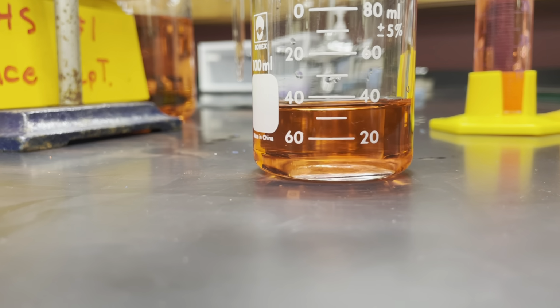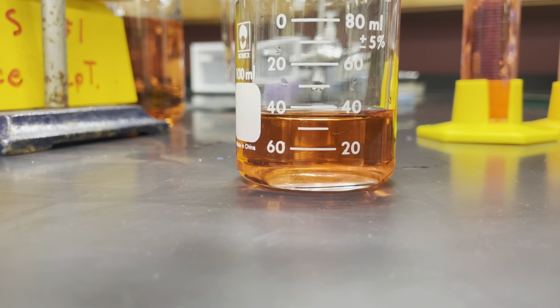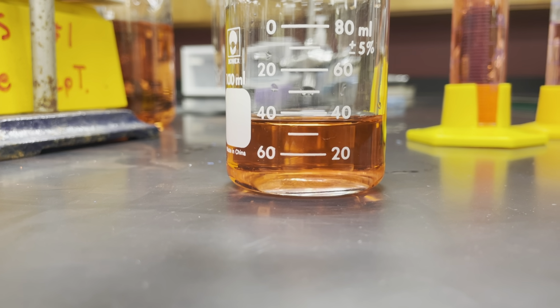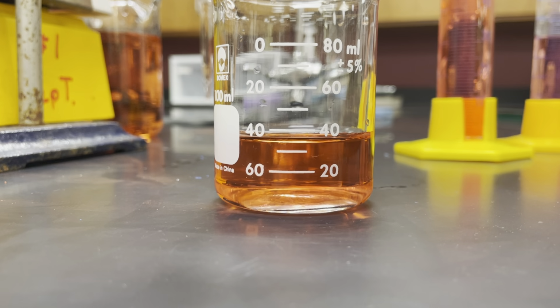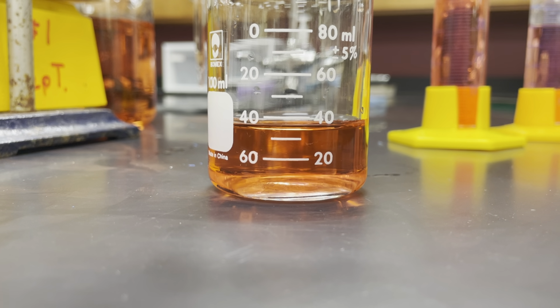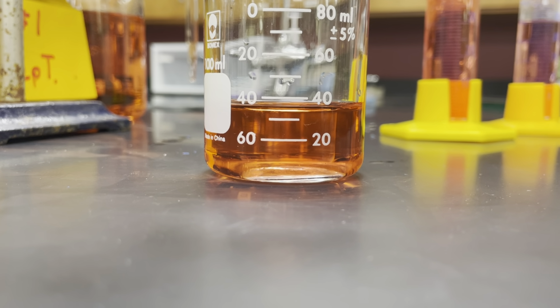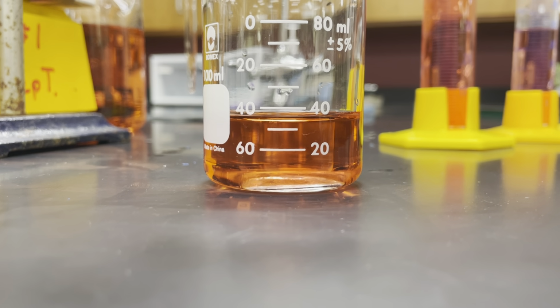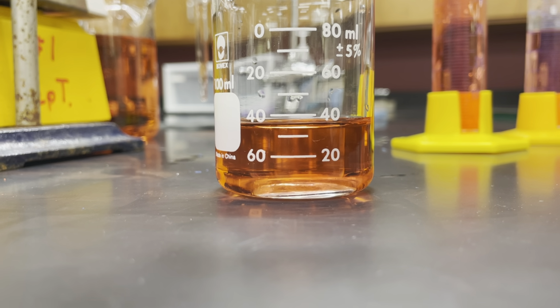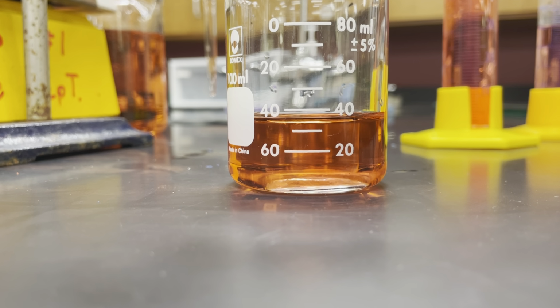Now, in between here, we have no more lines to split hairs of where we are. So this could be 35 milliliters, it could be 36 milliliters, it could be 32 milliliters. It's hard to say. It depends on how you look at it. This is the point of uncertainty, where we can no longer say for sure how this measurement is. We know for sure it's going to be between 30 and 40, but we can't say for absolute sure whether it is 35 or 36 or 37 or 36.5 or 36.5555, 2527, who knows?